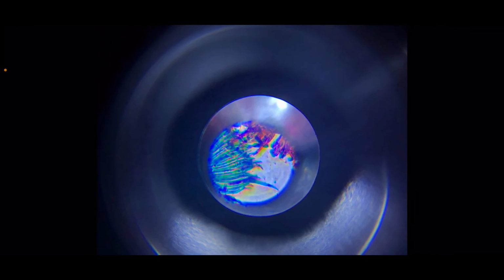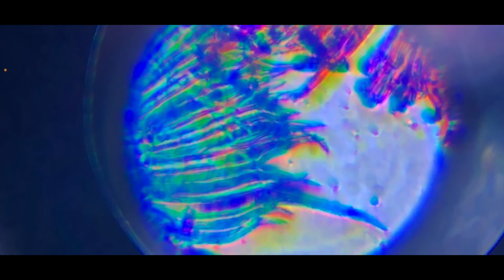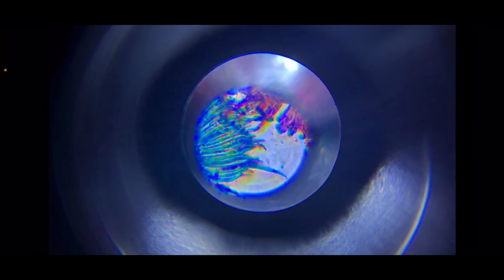And now we have this green part as well. This green cell is just marvelous. It looks like a peacock's tail almost. You can see that this is blue, green, neon, all types of colors. Overall, this is just so cool, and I encourage you guys to explore more cells on your own if you have a microscope or use one at your school.